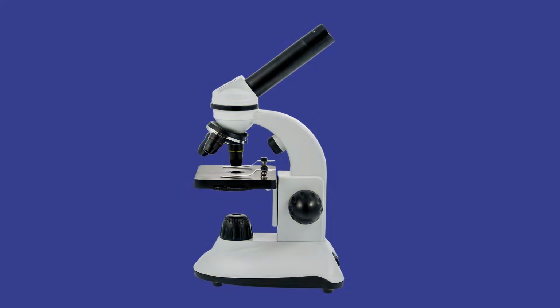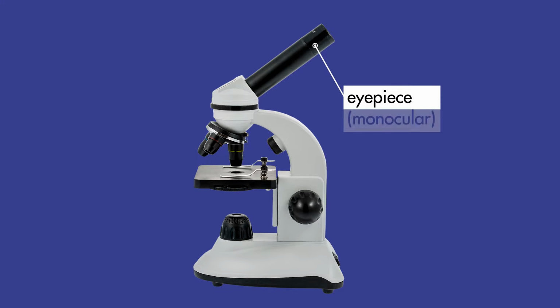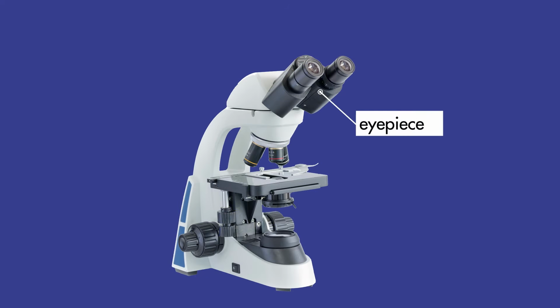A compound microscope with an eyepiece containing a single set of lenses is monocular. One with an eyepiece containing a double set of lenses is binocular.